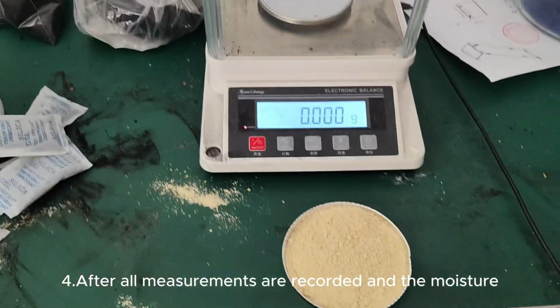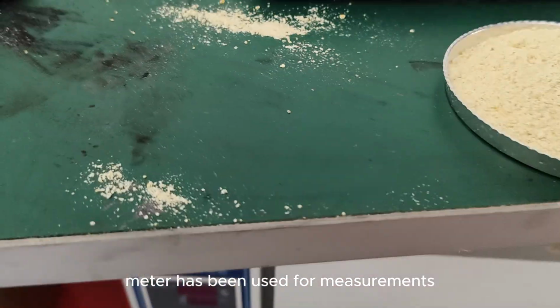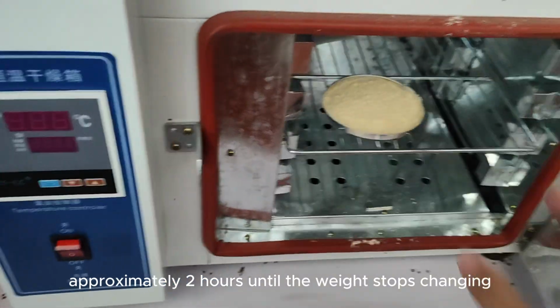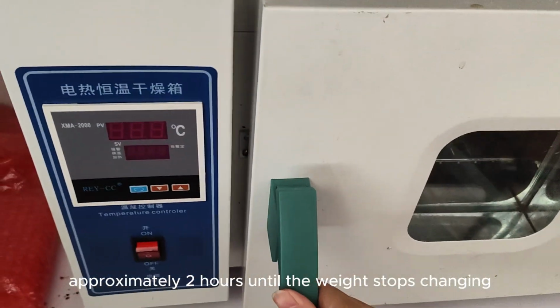4. After all measurements are recorded and the moisture meter has been used for measurements, place the sample in the oven for complete drying, approximately 2 hours, until the weight stops changing.